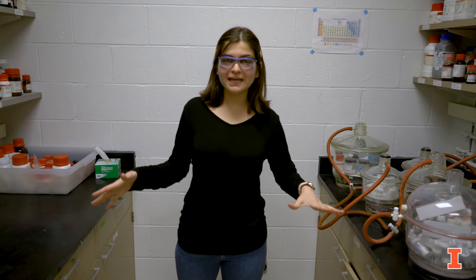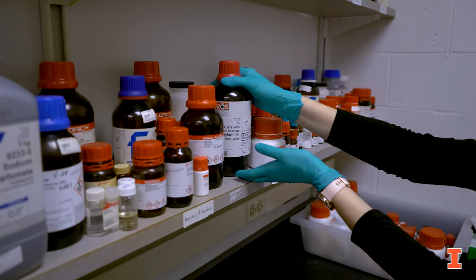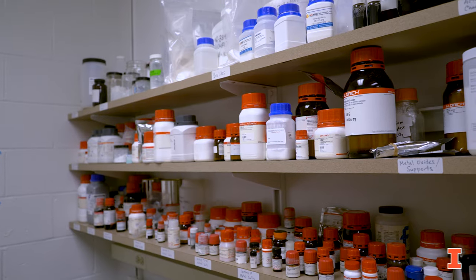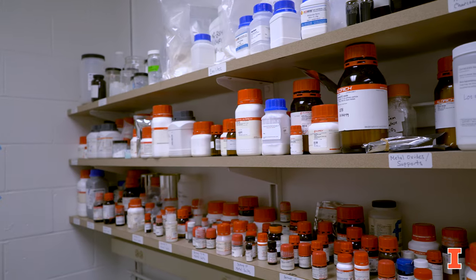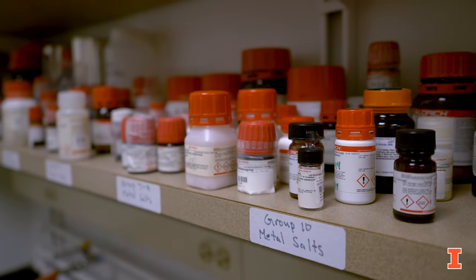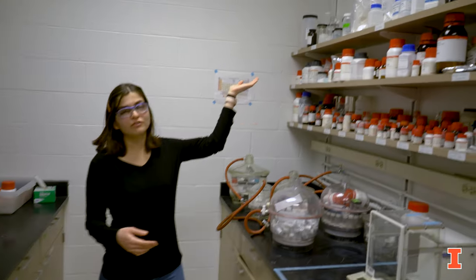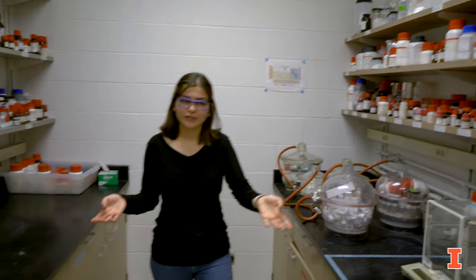This is our second lab space, and this space is dedicated to synthesizing catalysts for our different chemistries. This is where we store a bunch of our catalyst supports, including metal oxide supports and metal precursors, as well as several zeolite frameworks. Let's go over here to look at some syntheses.